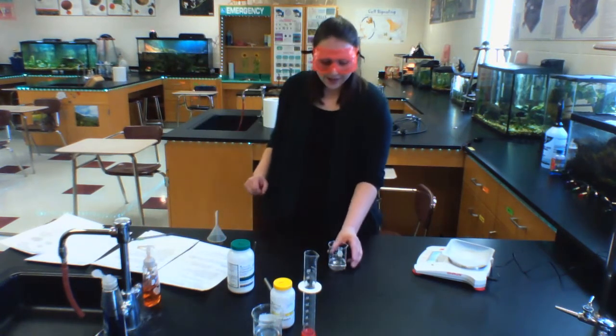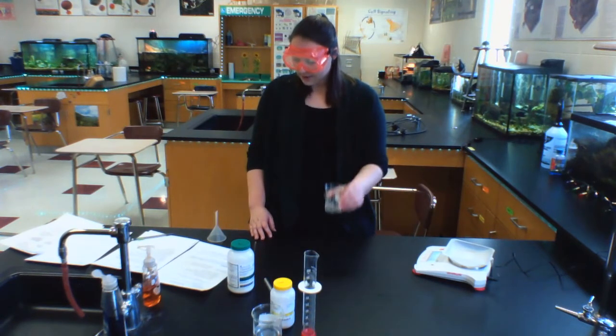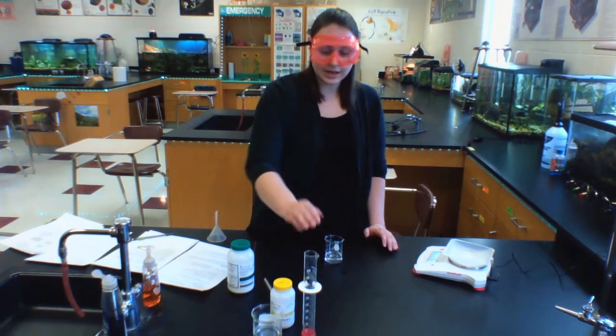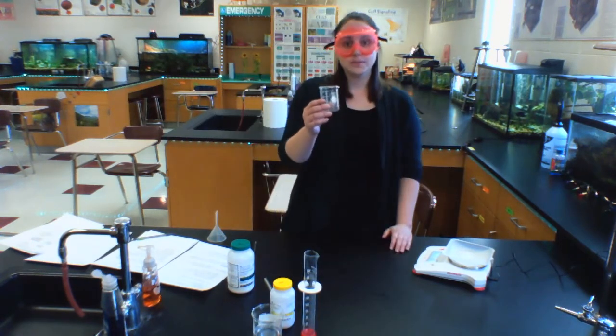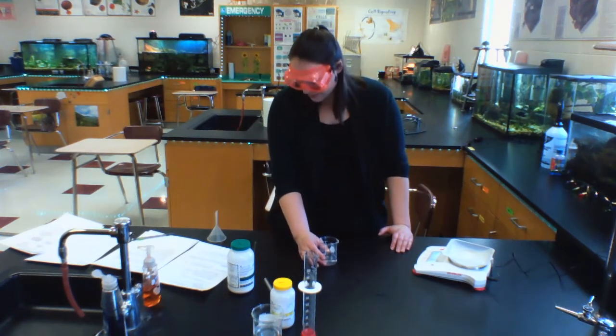So I want to add this potassium iodide and my lead nitrate solution to the beaker that I had. I would not want to have added that to a graduated cylinder because it might have gotten stuck and not come out. So I do need to make sure I'm already going to add it to the beaker where my reaction will take place so that all of it can go into the beaker.